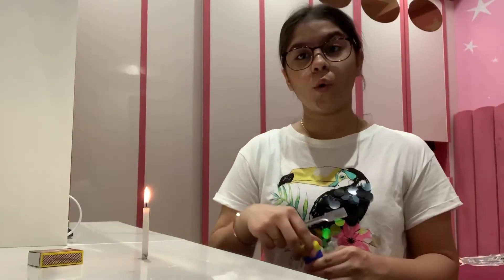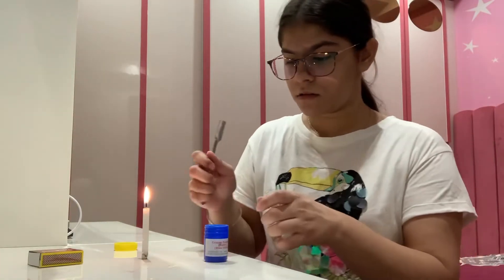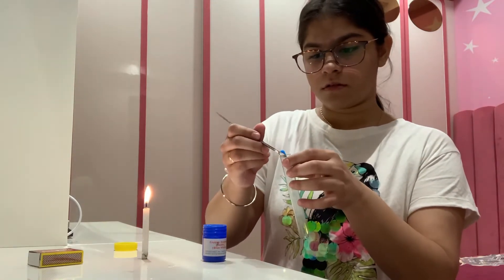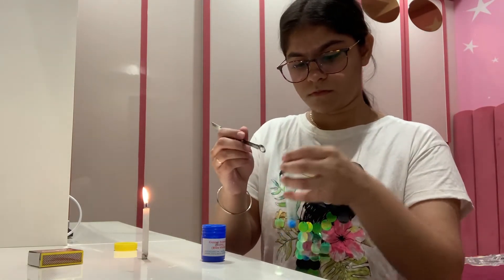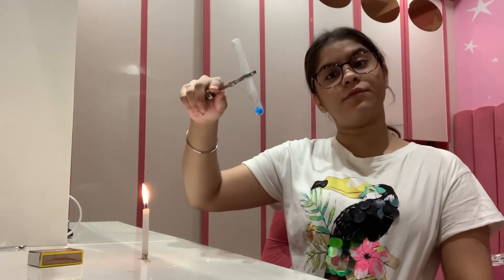This is the experiment we are going to be performing today. In the test tube, I am taking the copper sulfate. Here is the hydrated copper sulfate, the blue vitriol. It has five water molecules of water of crystallization. Now let's heat it.